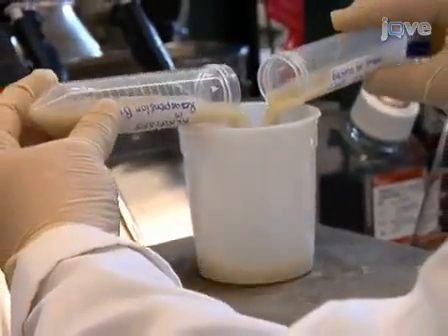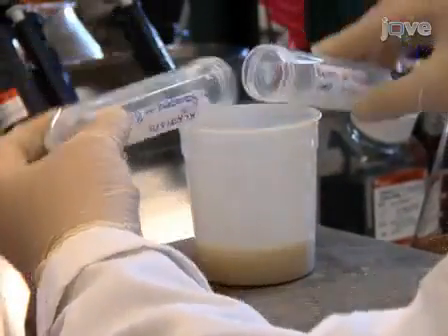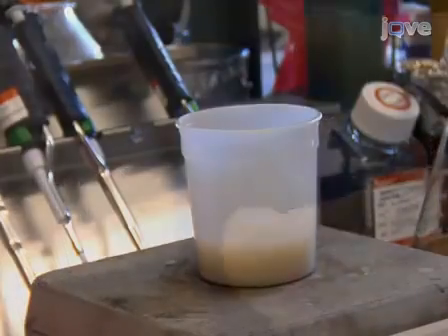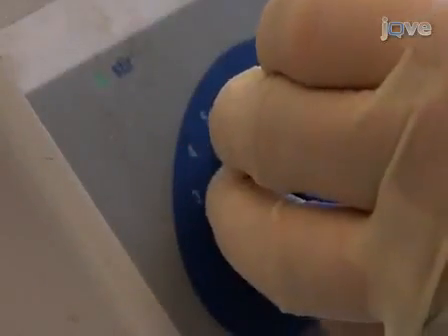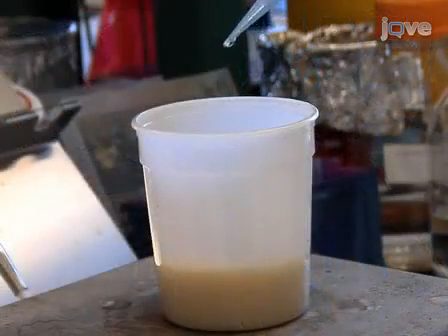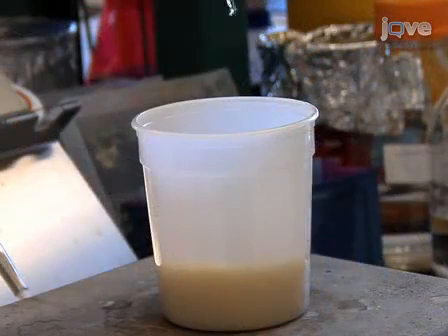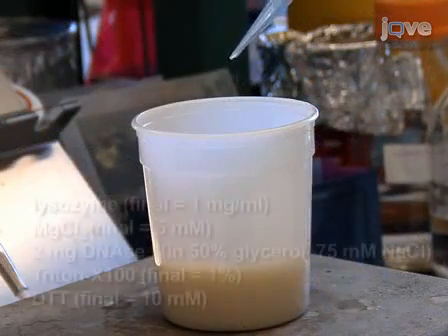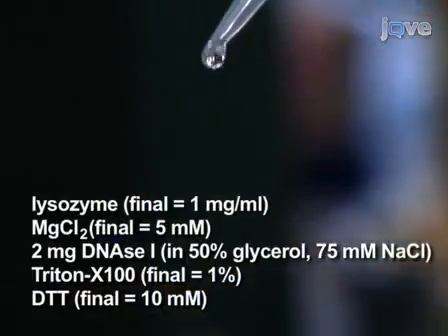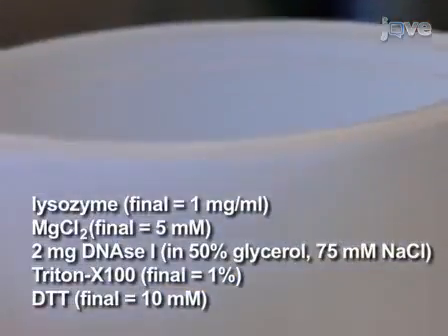Next, pool bacterial resuspensions up to a 60 milliliter volume in a polypropylene beaker. If necessary, bring the total volume up to 60 milliliters with extra TE buffer, pH 8, and stir the mixture at half speed on a hot plate stirrer. While the pooled resuspension is stirring, add the following solutions dropwise to the mixture: lysozyme, magnesium chloride, DNase 1, Triton X100, and finally DTT.